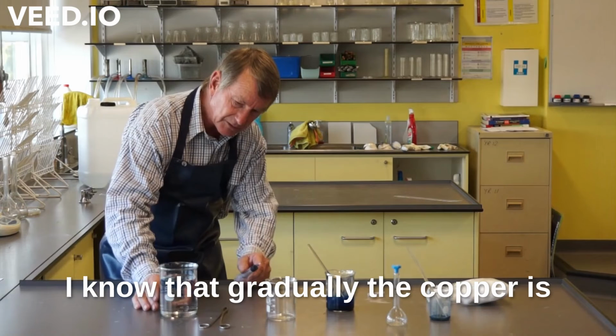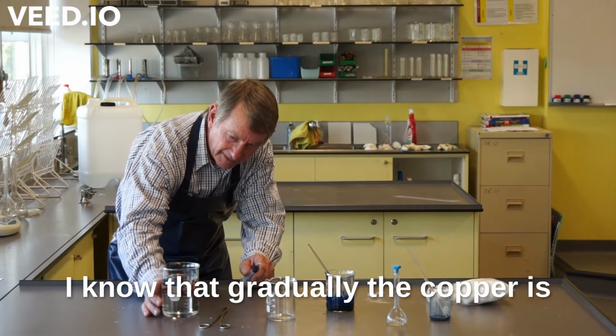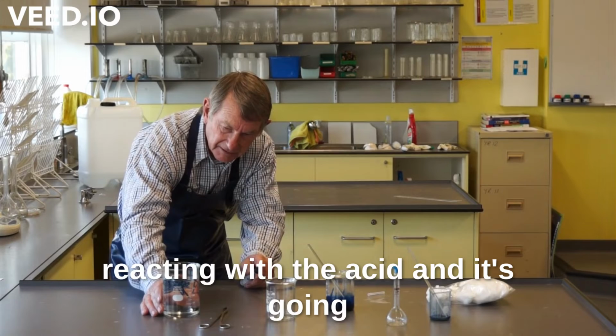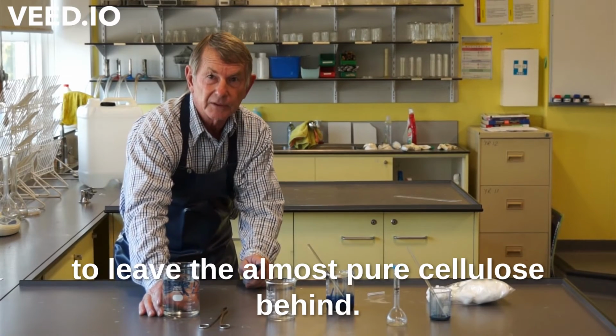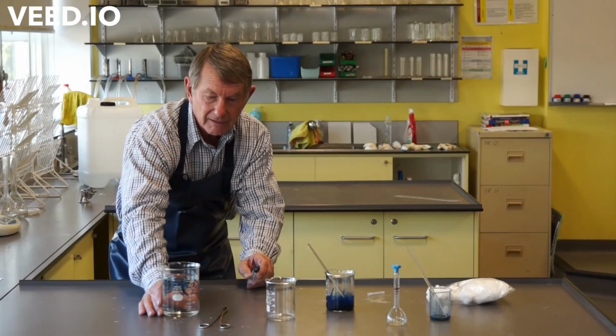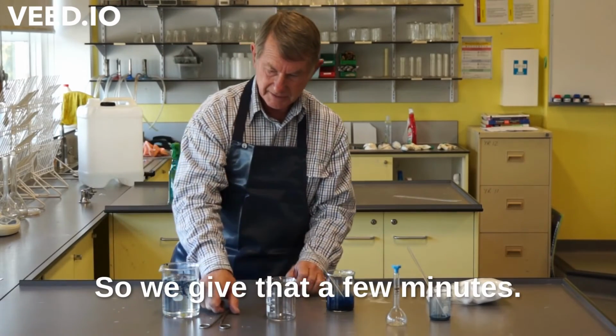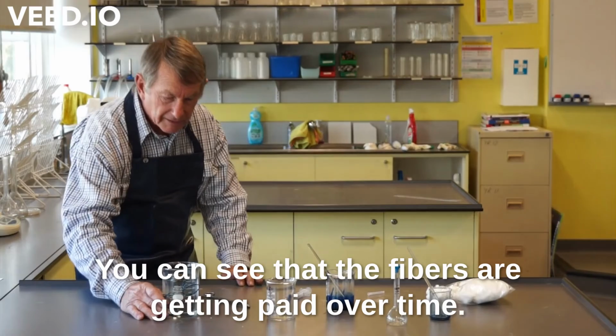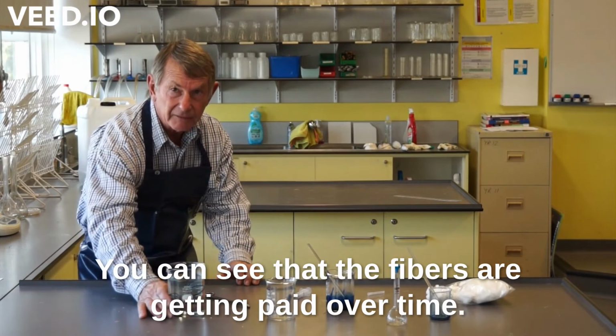You'll find now that gradually the copper is reacting with the acid, and it's going to leave the pure or almost pure cellulose behind. So we give that a few minutes. You can see that the fibres are getting paler over time.